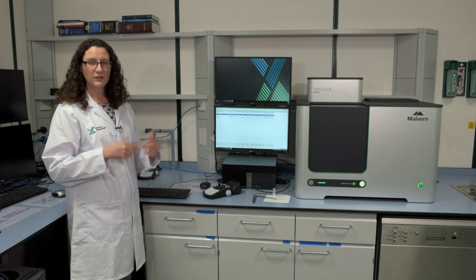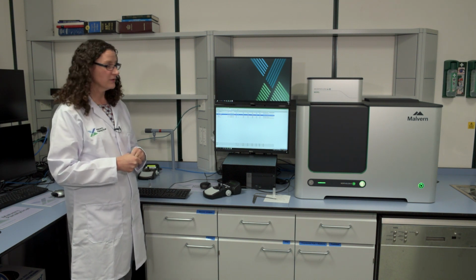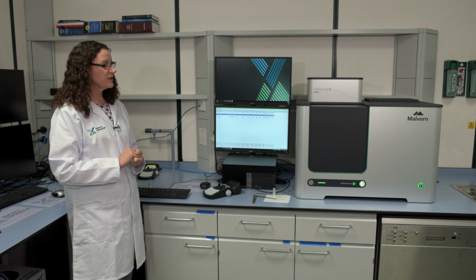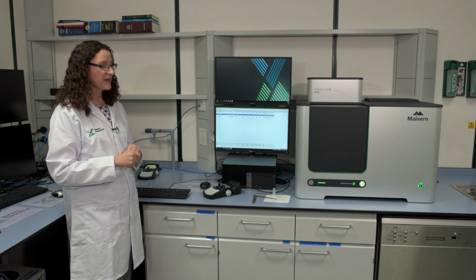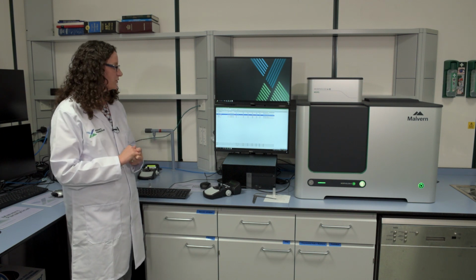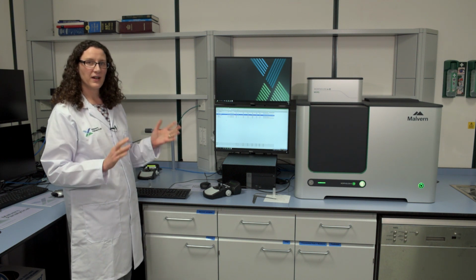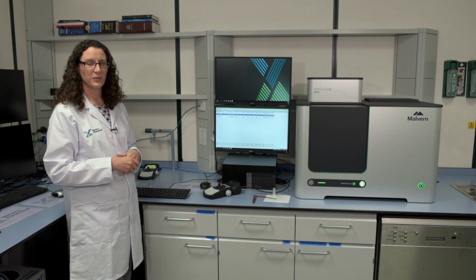Hopefully you can see the wealth of information that morphologically directed Raman spectroscopy can bring to you. We've demonstrated a dry powder. It was a blend. We've characterized it morphologically, and we've collected some Raman spectra from over 800 particles in the previous analysis that I did, and I've shown you how you can separate that data and compare the size and shape of the individual components within that blend.